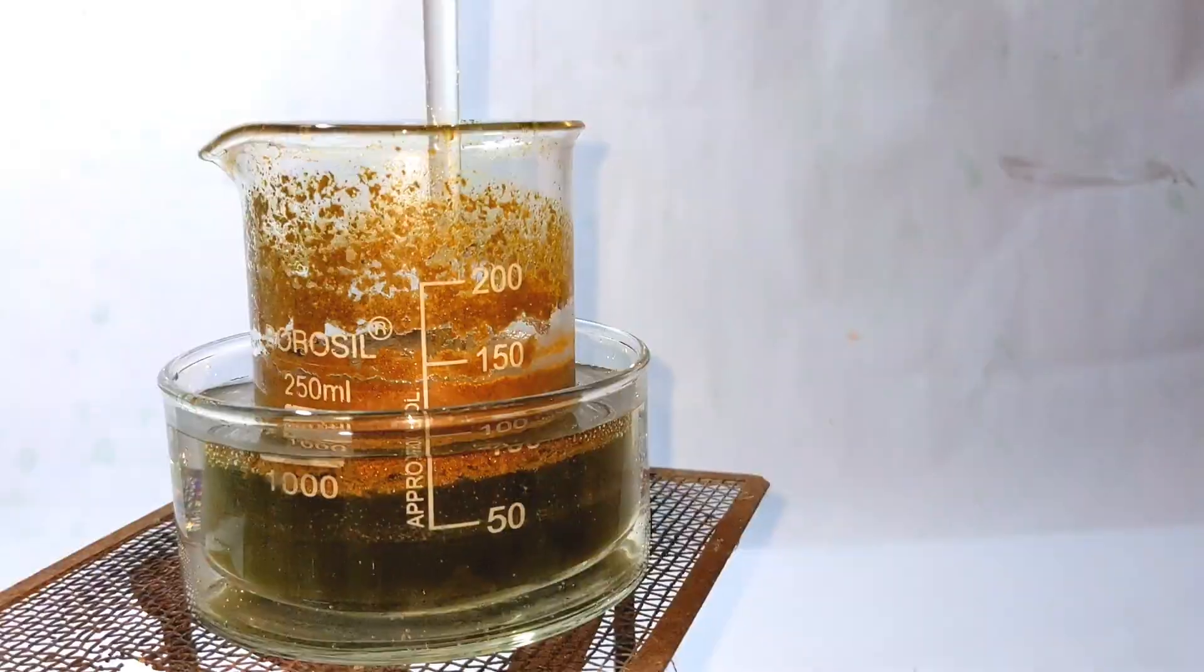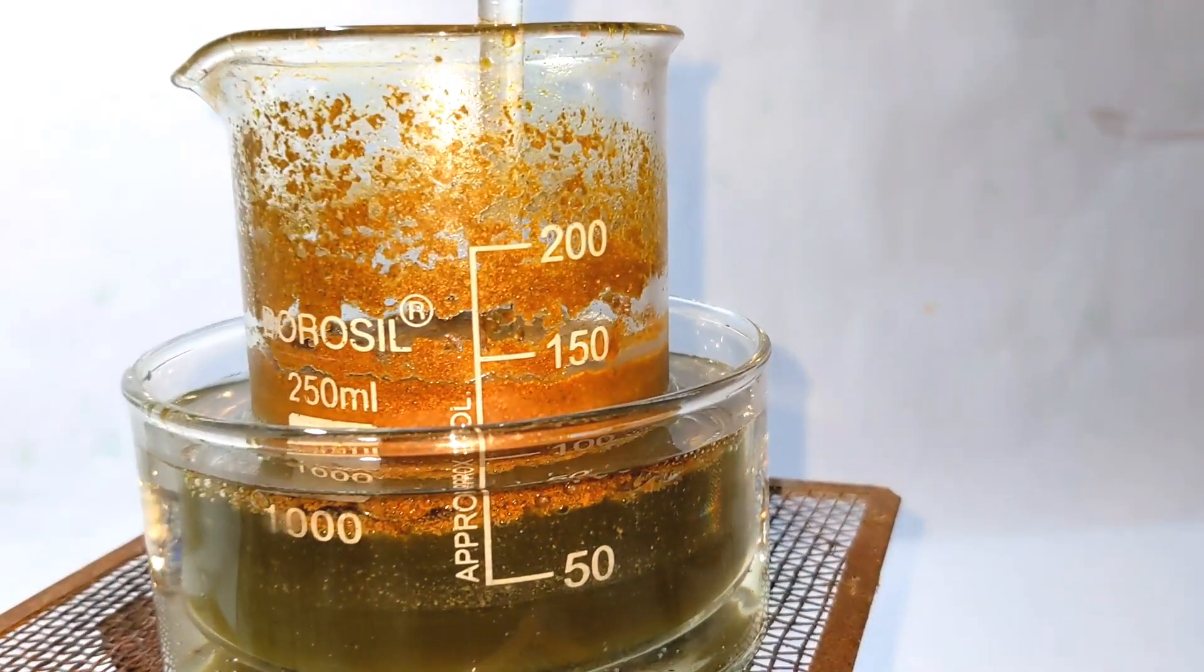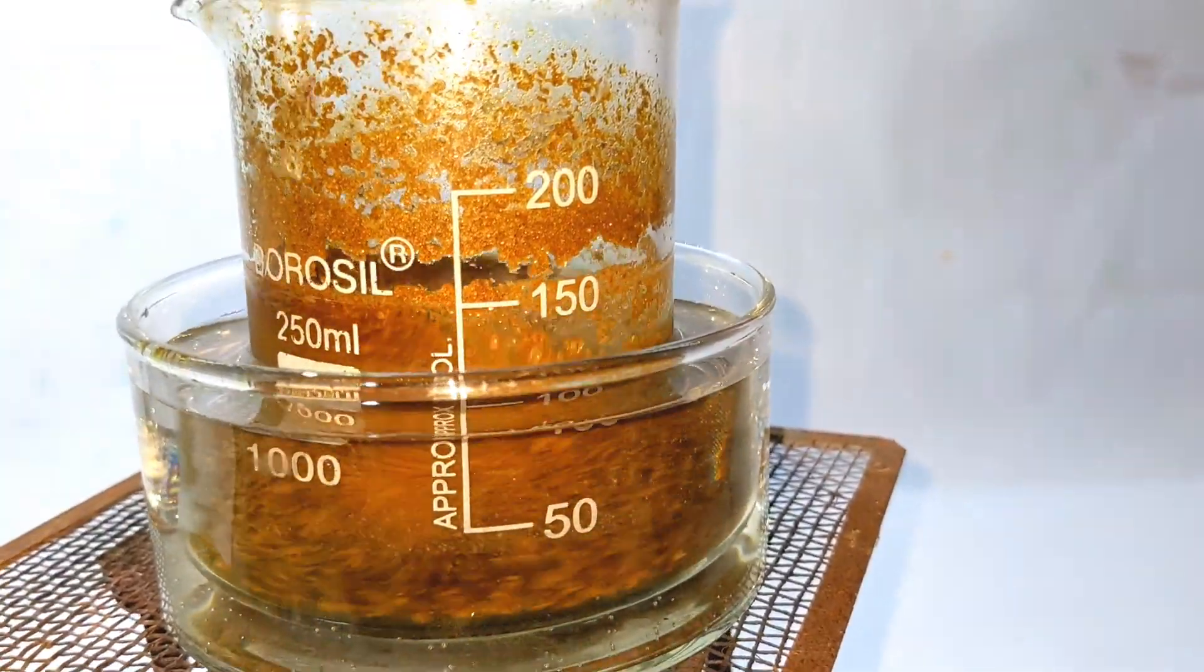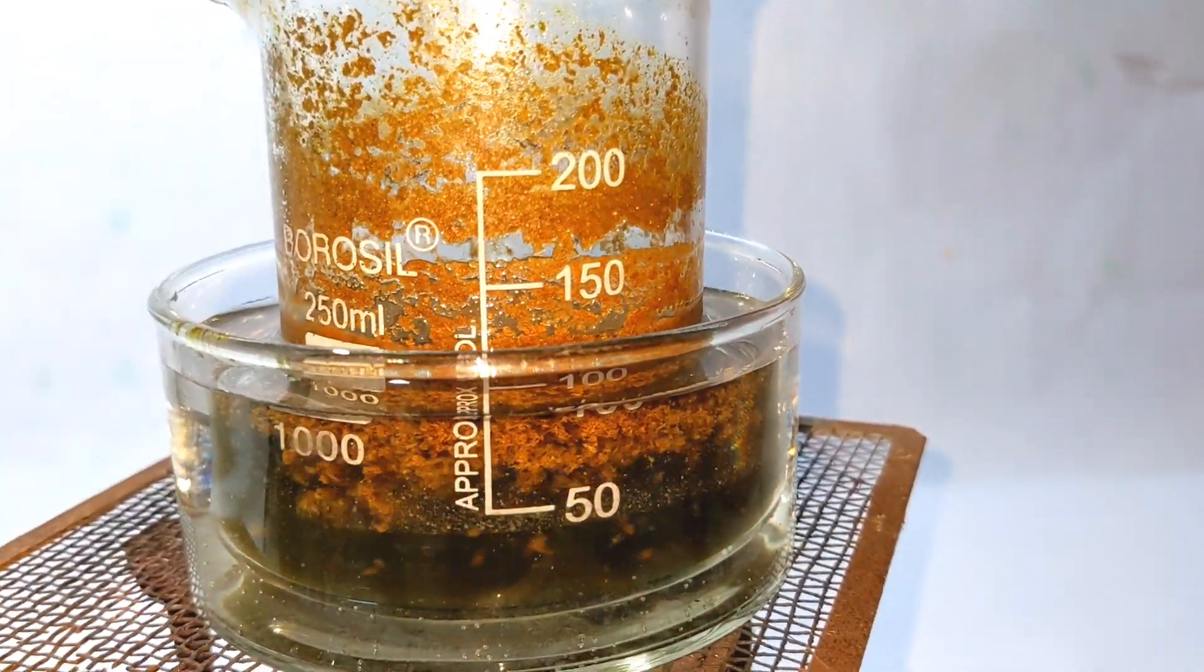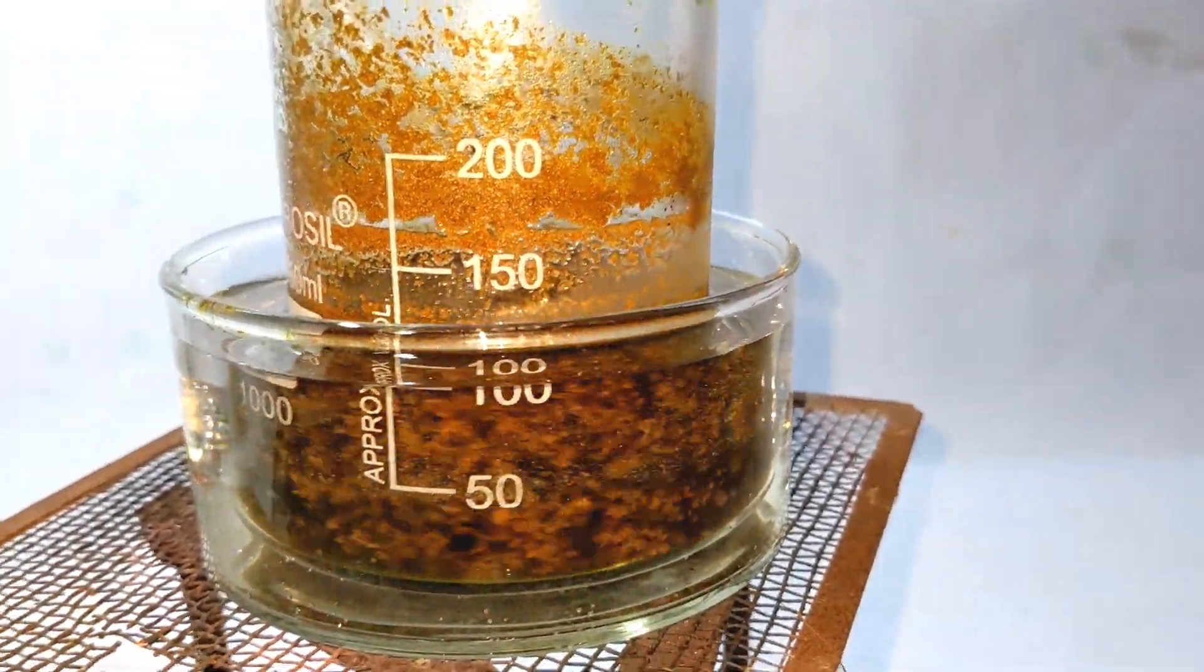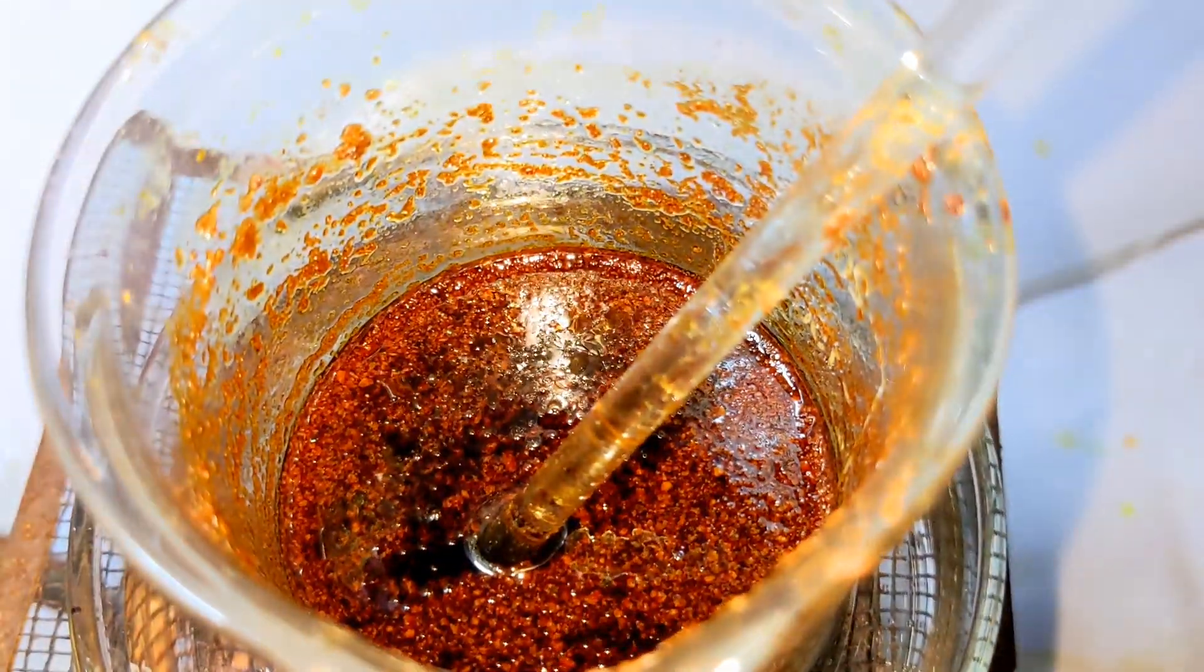Most of these will dissolve on gently warming on a water bath at around 60 degrees Celsius. This is because the addition products break down at this temperature resulting in the formation of oily droplets of parachlorotoluene.